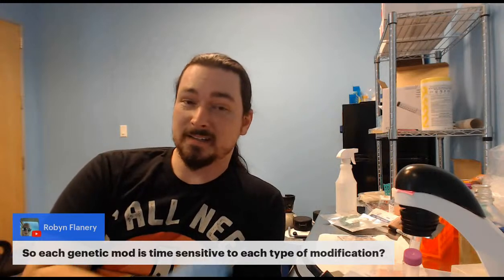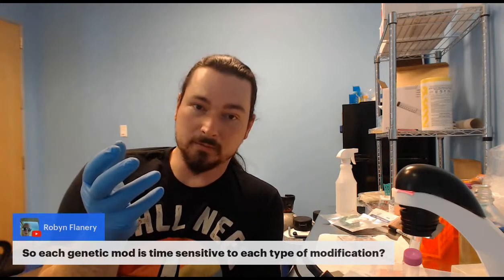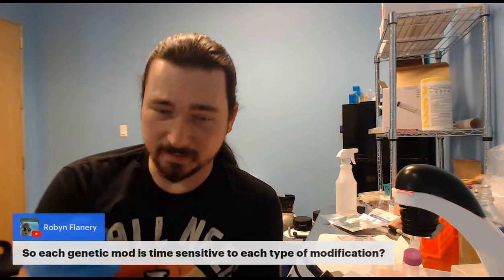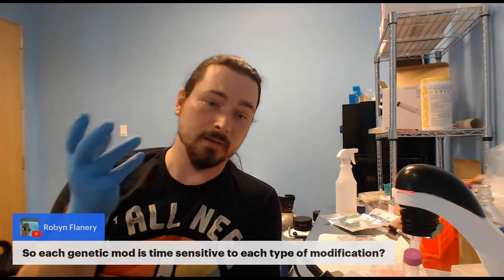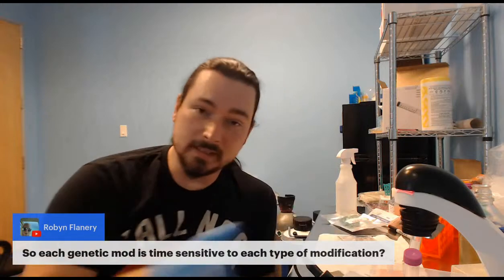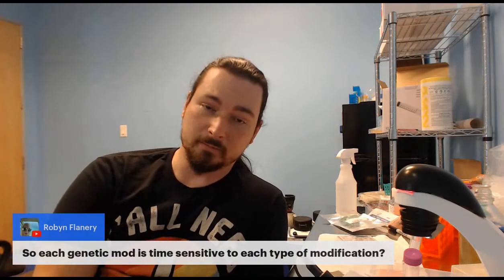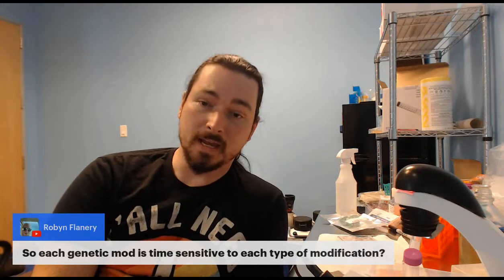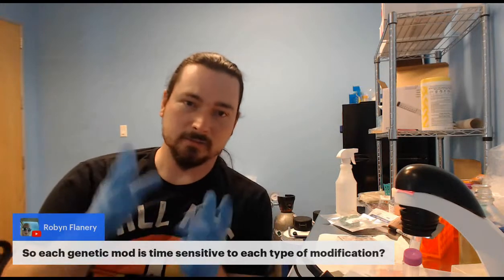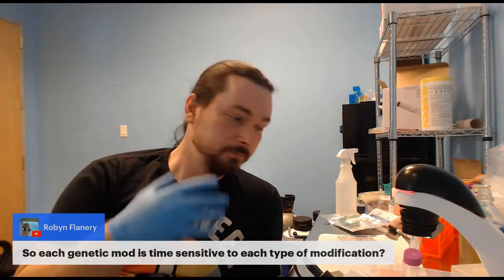But because this is an enzyme, it's a pretty stable protein. That's another thing, protein stability. It'll just float around in the media, right? So some of it's in the cells, of course, but a lot of it's also just in the media from cells that have leaked or whatever. And so as soon as you add it, it just immediately starts changing.